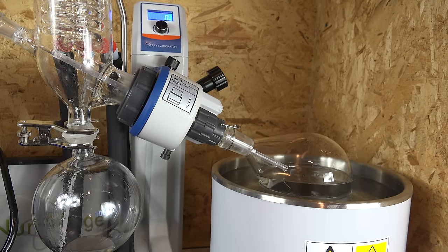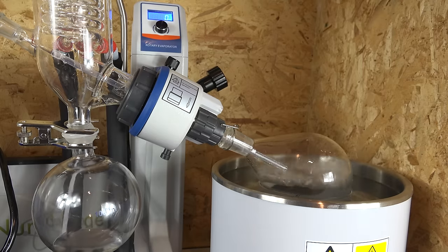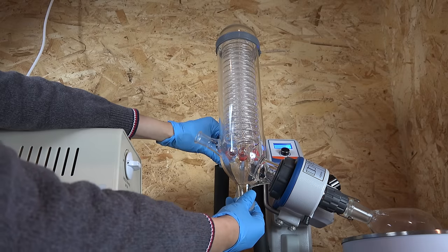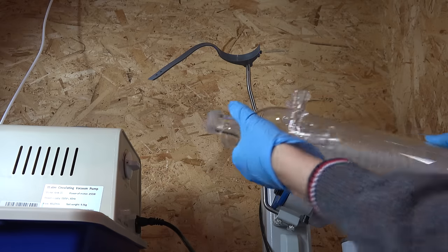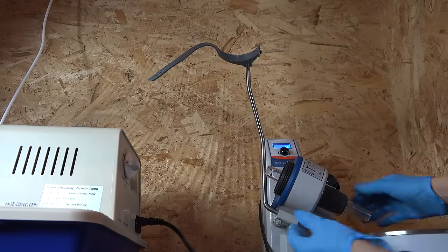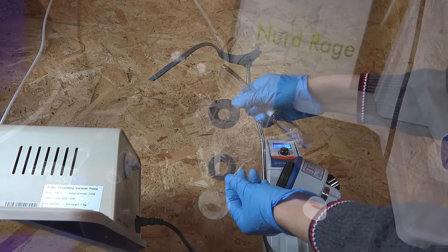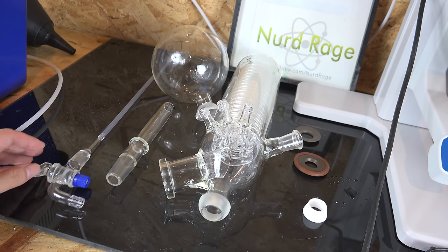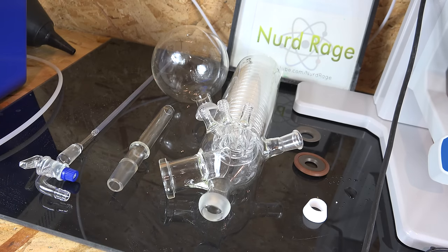I've been asked to discuss how you would clean something like this, especially after bumping has contaminated it with unwanted residues. It's not too involved, just very slow and difficult to get completely clean. First, all parts are disconnected — the receiver flask is removed, and the coolant and vacuum lines are drained and disconnected. The condenser is then removed along with the various springs and rings. It's extremely delicate so you have to be careful. The neck can be cleaned directly with a brush and solvent, but I'm going to dismantle that too — here is the neck along with the sealing ring and gasket. These are all the parts that get contaminated during bumping. Cleaning is most often done by soaking in water or solvent; the rubber sealing rings and gaskets are damaged by solvents so they need to be scrubbed with soap and water only, or completely replaced if too damaged. The glass parts are often cleaned in an ultrasonic bath.